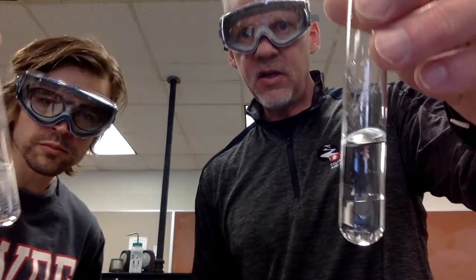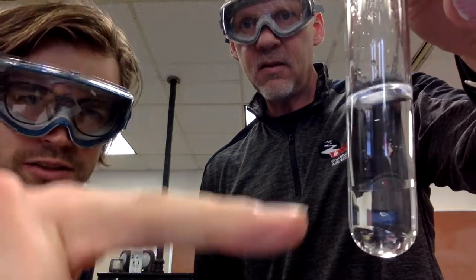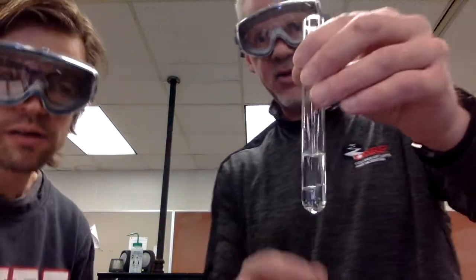Now I'm going to do a similar thing with methyl tert-butyl ether. I'm going to put a couple of squirts in there. And what you can see here initially is the two layers. You can see the interface is essentially right there. Yep, and I'm going to give it a shake just to keep everything equal here. And we'll bring it back up.